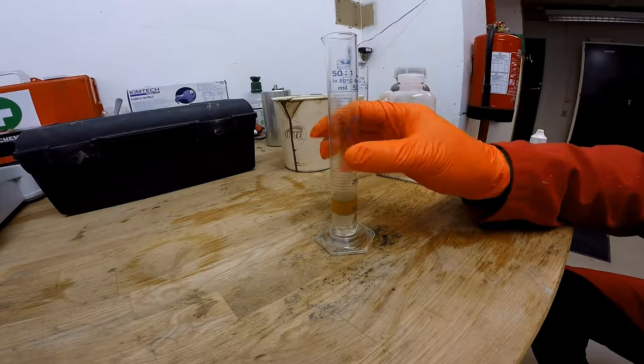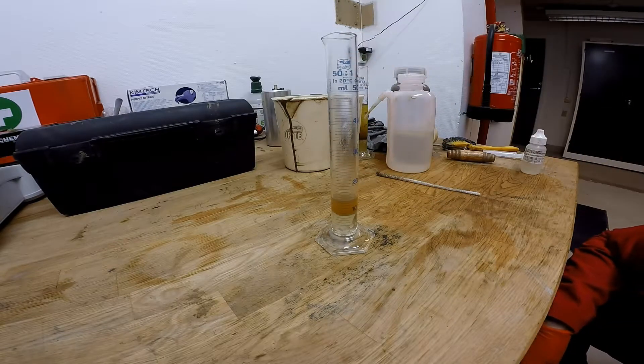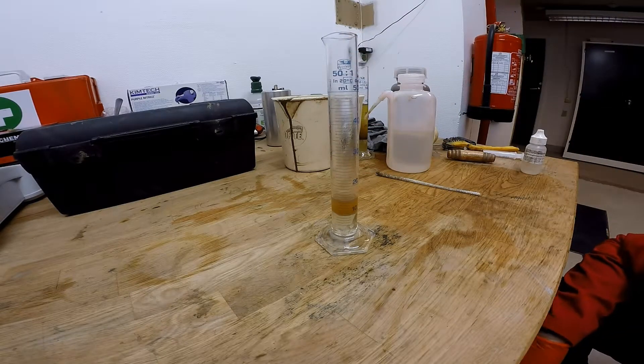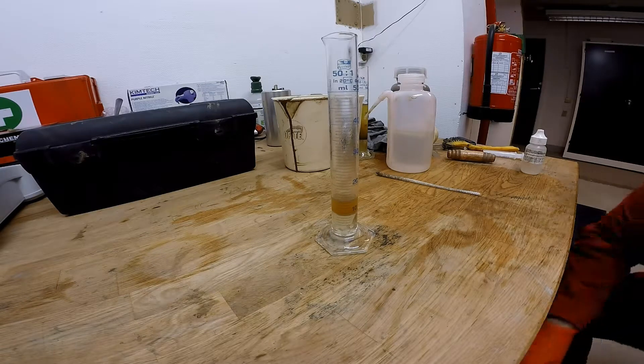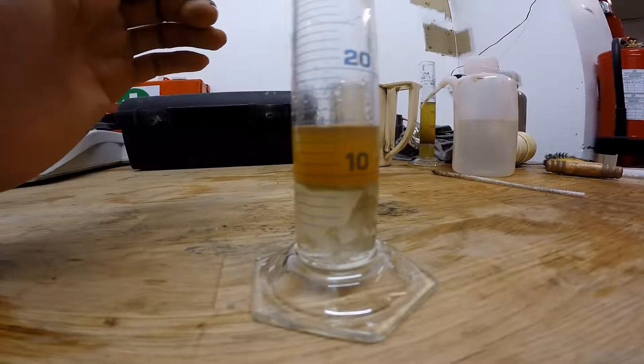So we want a total volume of this and a volume of water. You want to have eye level with the cylinder so you can get an accurate reading, and you can add it into your computer.